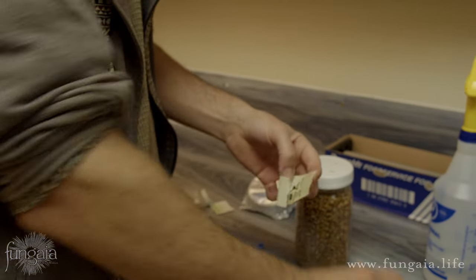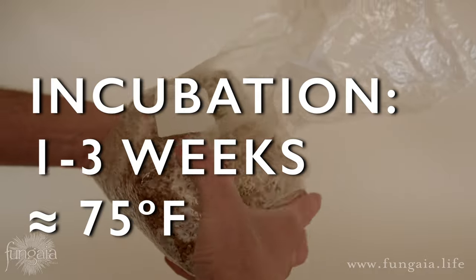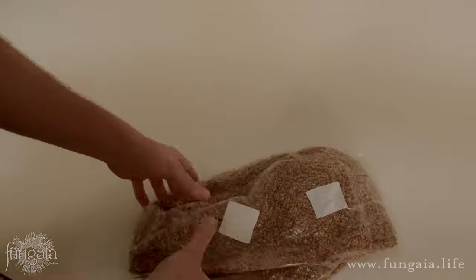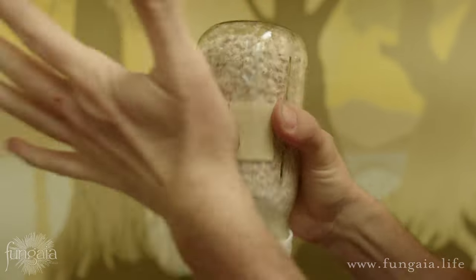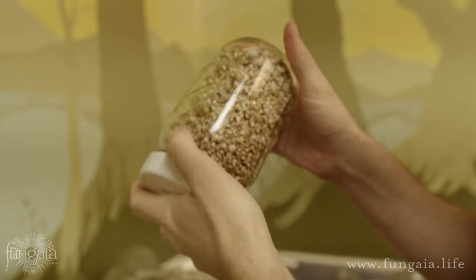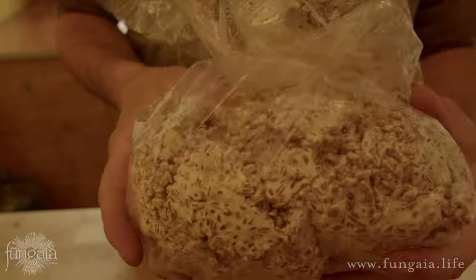All you have left to do now is sit back, relax, and watch it grow. We'll let this grain spawn incubate for usually about one to three weeks depending on the species. It's pretty cool to see the mycelium slowly expand and envelop each of those grains — each one becomes kind of like a seed or satellite colony of that fungus when we add it into the next stage of cultivation. Incubate your grain spawn in a warm place away from direct sunlight. As it grows you may notice untouched patches of grain — more often than not it's necessary to mix the grain spawn at least once during incubation. Break up the mycelium by knocking the jar against your palm or against something like a stack of paperback books, then mix thoroughly by gently rocking the jar back and forth and twisting it at the same time. Once the mycelium has completely enveloped the grain it's safe to handle in the open air and ready to be used to spawn into your bulk substrate like sawdust, straw, or manure.